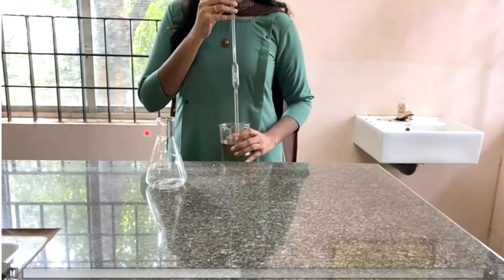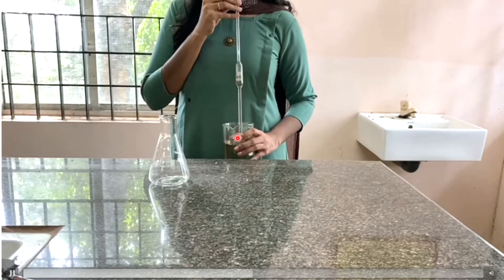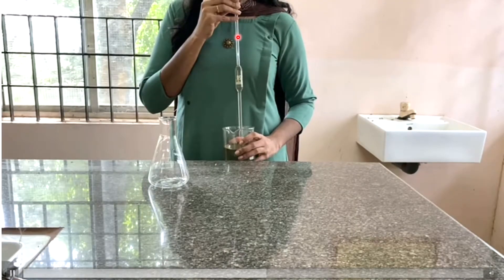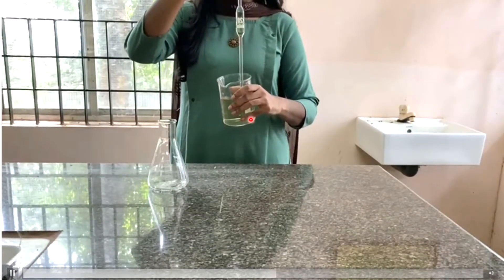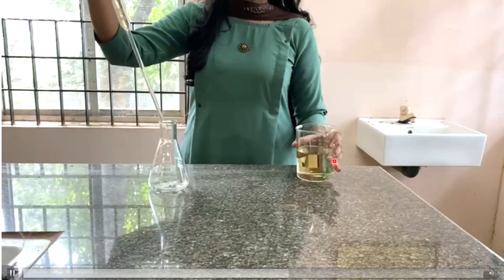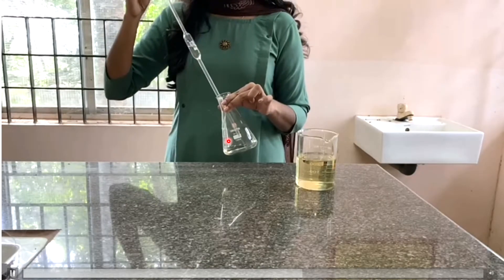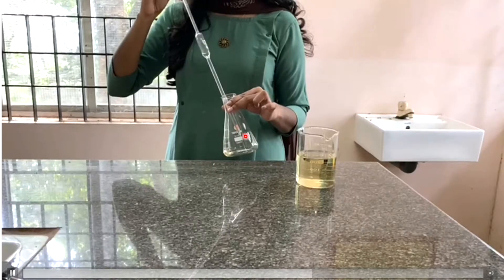Next, we start with the conical flask. Using a pipette, we measure out 20 ml of iron ore solution. The iron ore solution is dissolved in dilute H₂SO₄. We pipette the iron ore solution and transfer it completely into the conical flask.